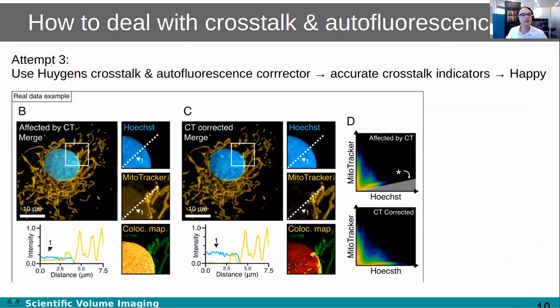Here I just show an example. This is Hoechst that is bleeding through, crosstalking, into the mitochondria channel. You can see in the line profile that in the mitochondrial channel there's this offset here. Now, if we correct for it, we can see that the signal in the nuclear channel increases and the signal in the mitochondrial channel decreases, because it's not supposed to be in the mitochondrial channel, it's supposed to be in the nuclear channel. But here at the edge, you can see that there is this signal in the mitochondrial channel which is actually in the mitochondrial channel. What's happening here is that you have a nucleus and a mitochondrion sitting at the bottom, and then they appear to overlap. So this signal is supposed to be there and that is maintained. You only correct for the contribution due to crosstalk and not for other contributions.